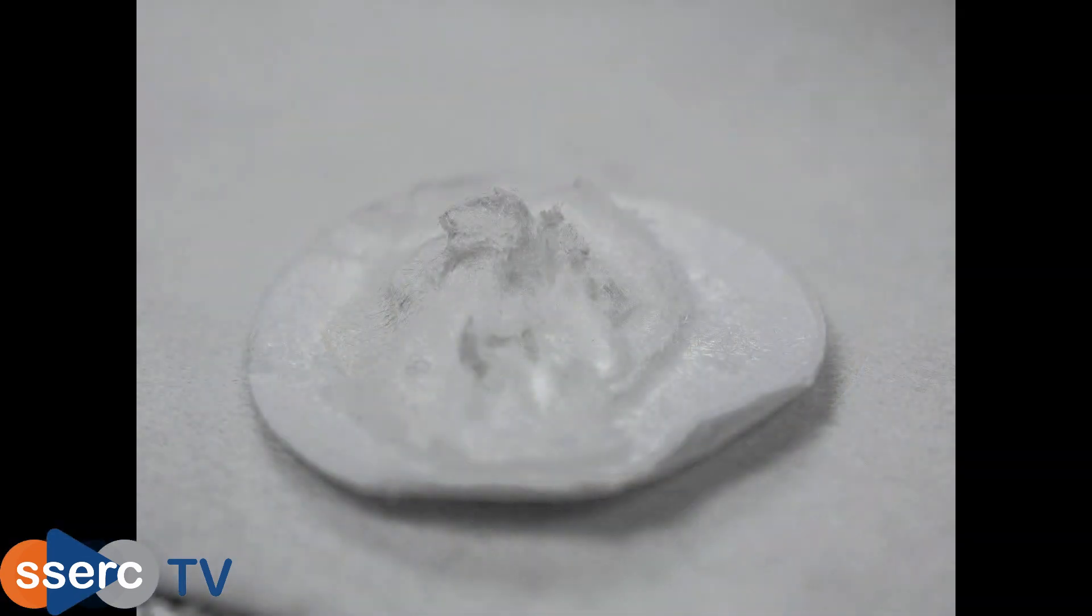The filter paper with the caffeine is then removed and allowed to dry fully.